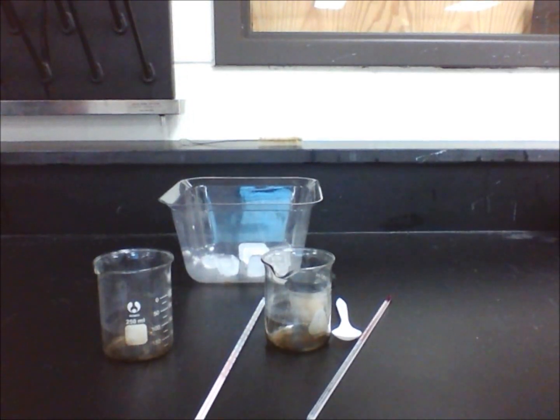In lab 18.1, students learn that the properties of a solution can be altered. If we add solute to a solvent, the properties such as melting point or boiling point changes.